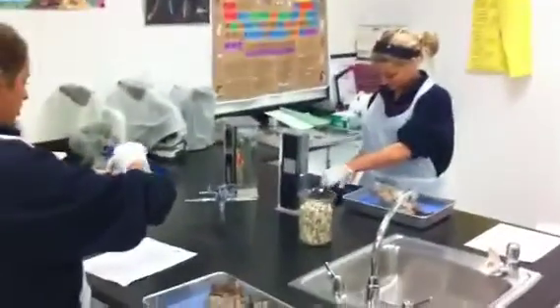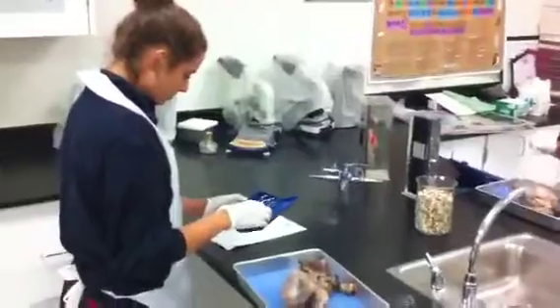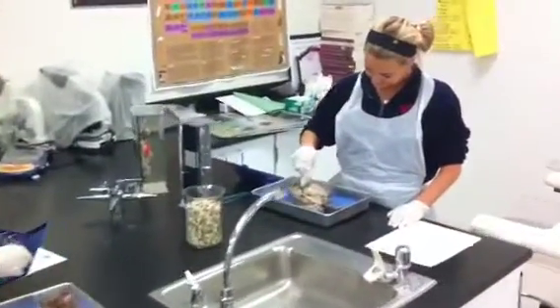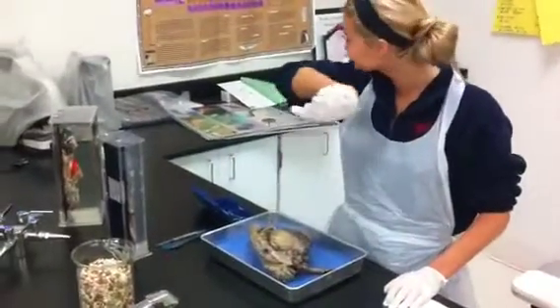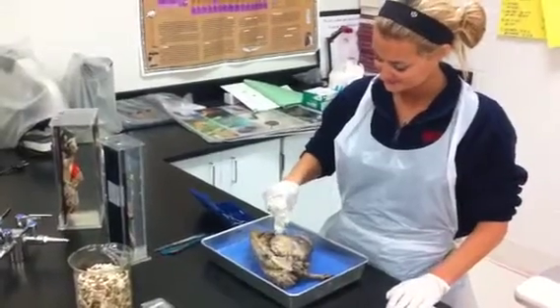Does it go all the way around? What is that? Where did you find that? So I noticed this is a pericardium right here. It's bad. The bad thing is I'm actually hungry. It never ends — yeah, it covers everything.